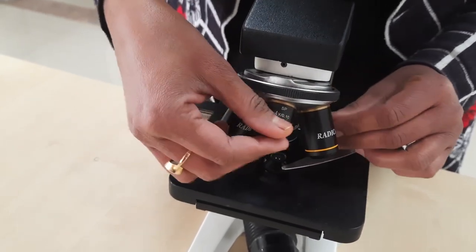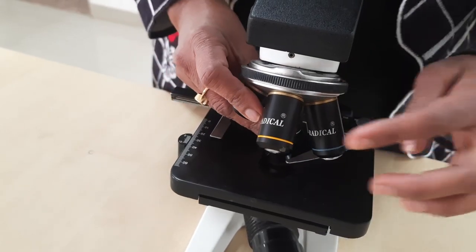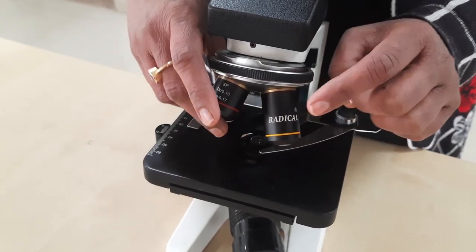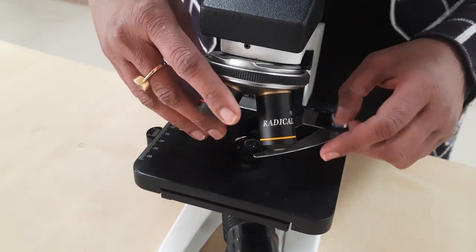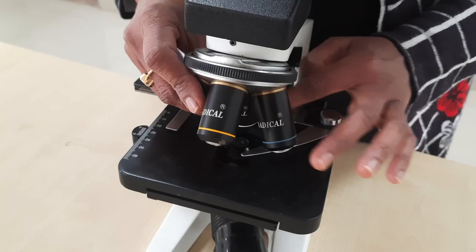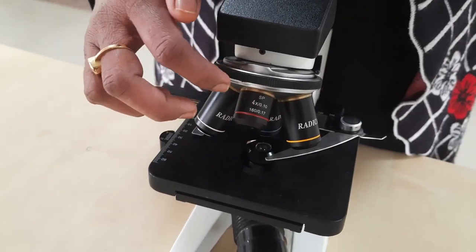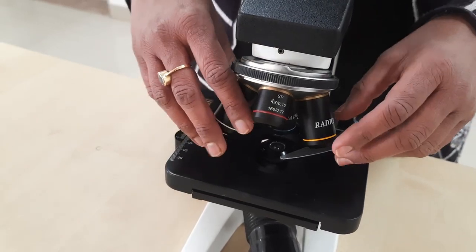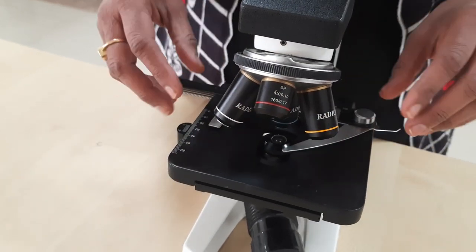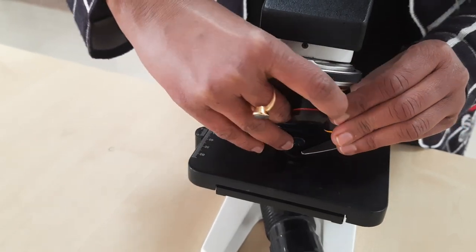The smaller red one (4x) is not used in your course. The yellow objective is 10x, the blue one is 40x, and the white one is 100x. So in your course, the yellow, blue, and white objectives are used.